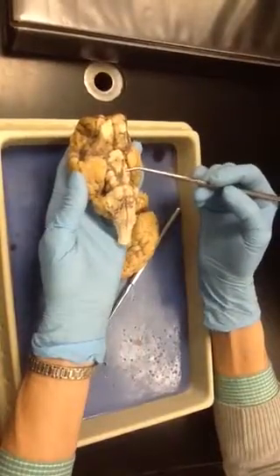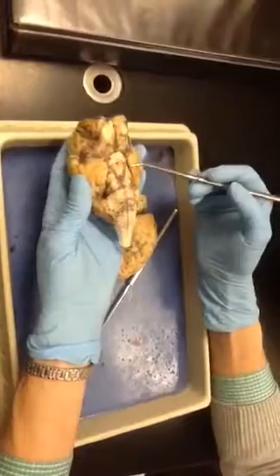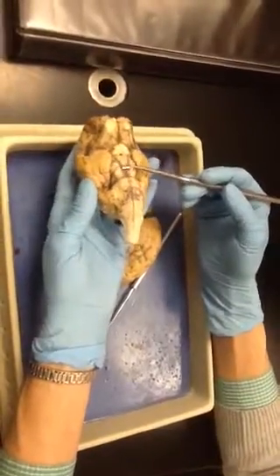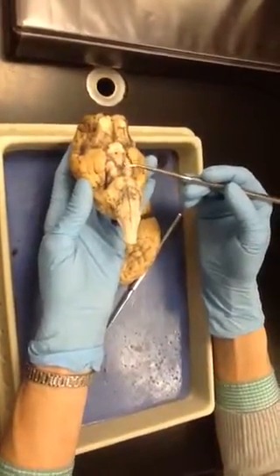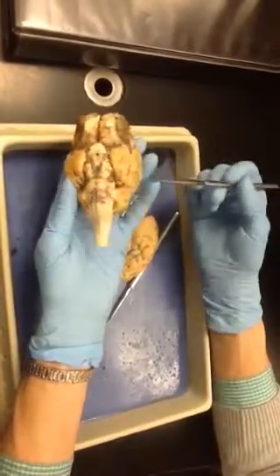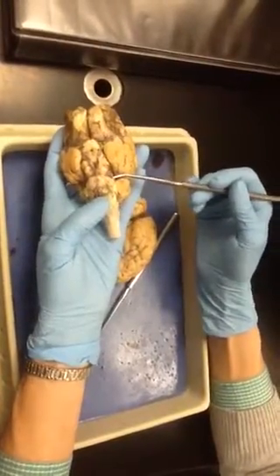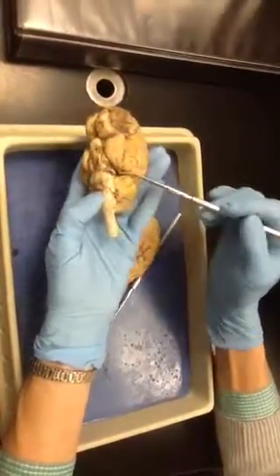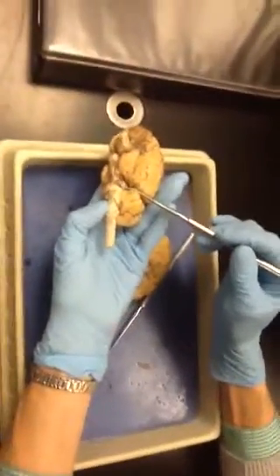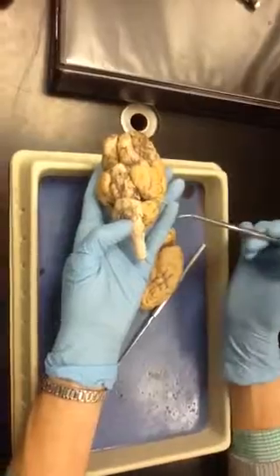Okay, if we come down here on the peduncles, and these are pairs. There's pairs of these. There's supposed to be pairs of these anyway. On the peduncle, we have this rather large flat nerve. That's called the oculomotor nerve. Coming down here on the side, we have this little bitty thing right here, this little white thing right there. You see that? You see that over there? Okay. That little white nerve right there, that's the trochlear nerve, the one that's on the side.